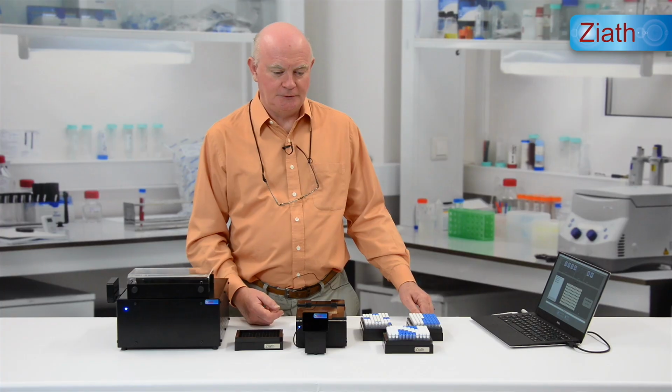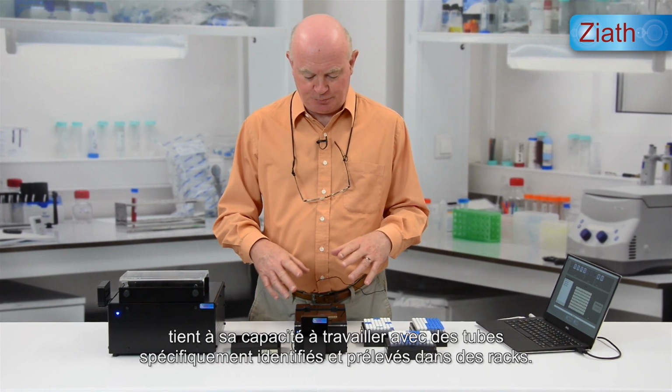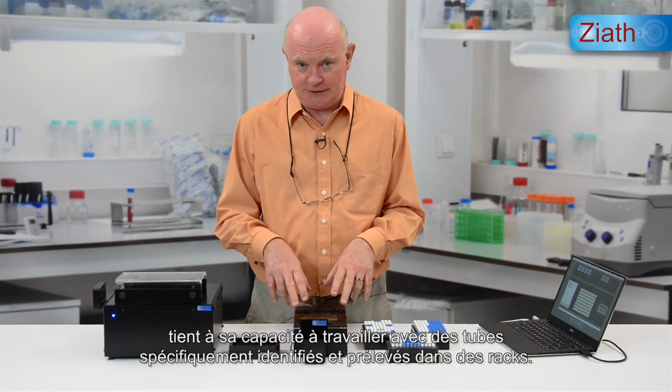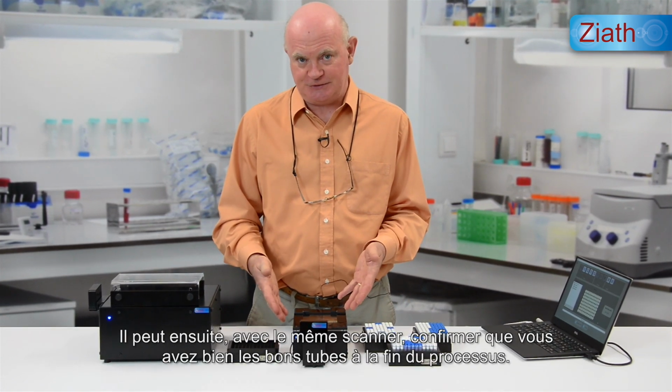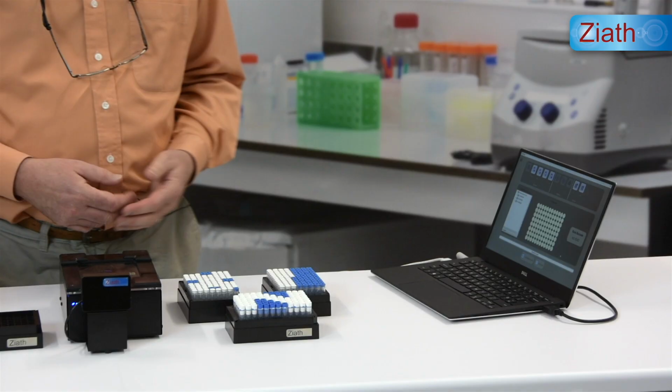One of the main advantages of the Mohawk tube picker working with the Ziath scanners is the ability to work with picked tubes that have been identified from the racks using the scanner, and then to confirm that you've picked the correct tubes also using the same scanner at the end of the process. So let's have a look at that.